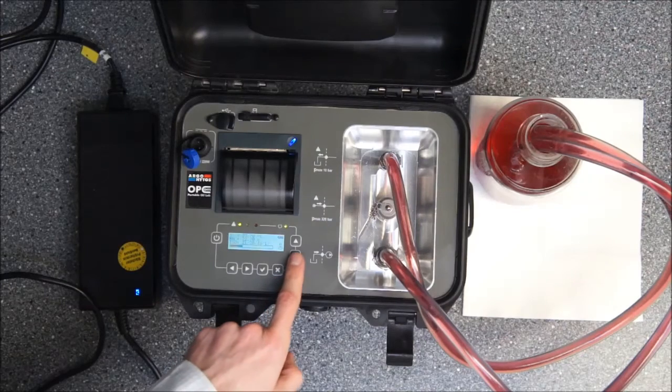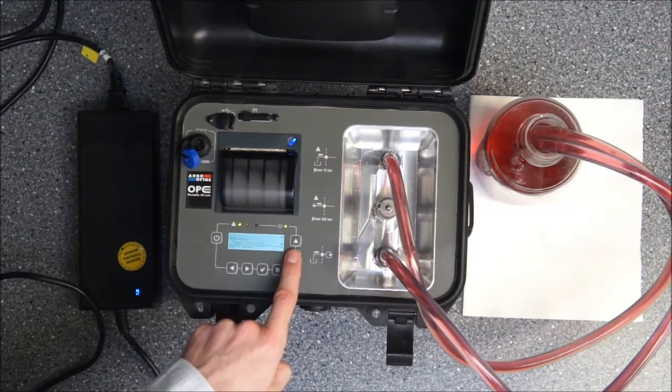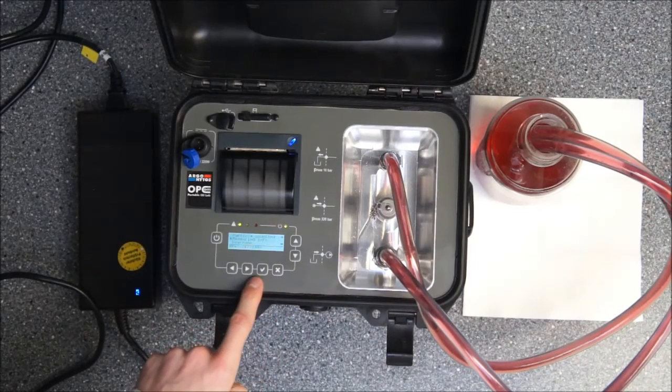While the measurement is running I will also show you some additional settings that you can do with the measurement. We have at the second point measurement information.